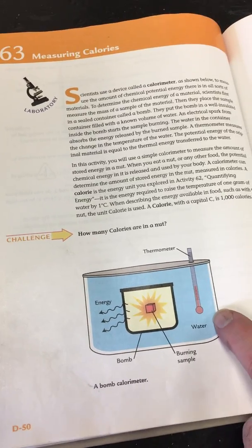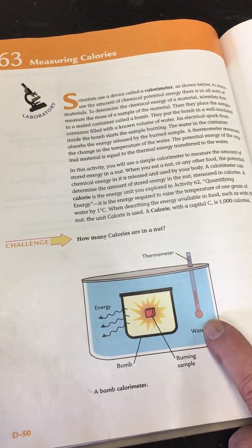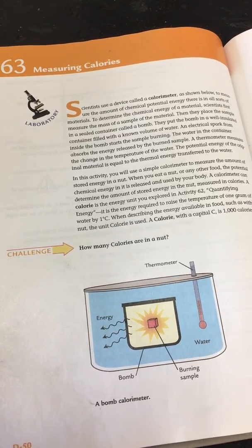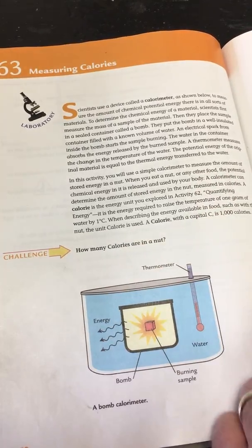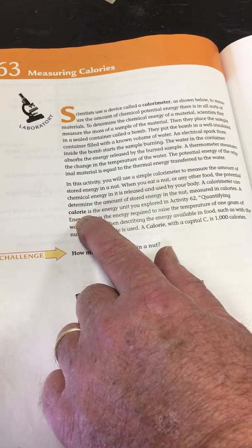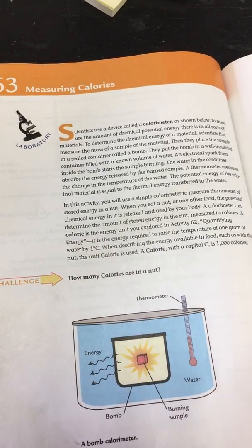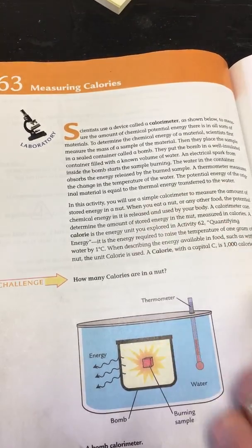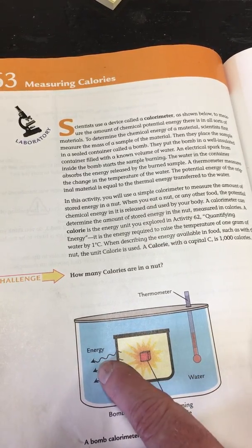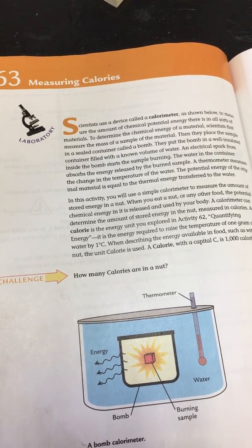Our energy released calculation is the temperature change times the mass of the water. That's what we're going to be talking about today. When that energy is released, we talk about it as a calorie, little c calorie, which is the stored energy inside of our Cheeto that we're going to burn today. The amount of energy stored in our Cheeto is also the amount of energy transferred to the water. That's how we can calculate the calories of our Cheeto.